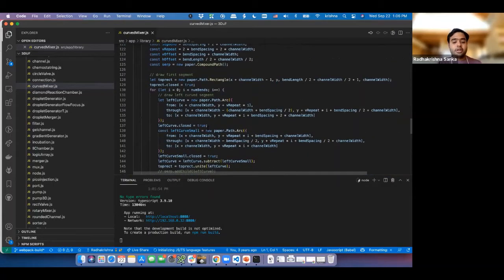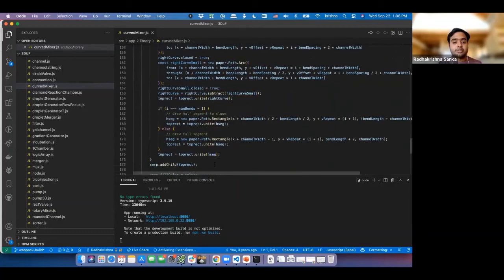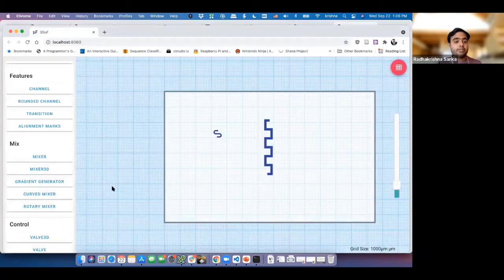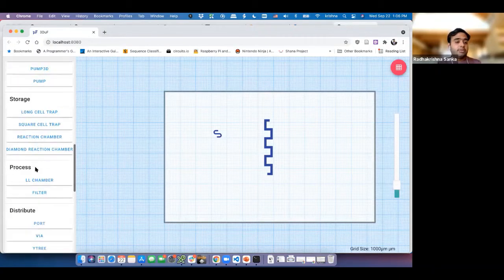So you might be wondering, okay, maybe this is complicated. I need to know how to do all these different things. How do I make something happen? Whenever you're approaching anything in a UI-based design and development environment, it's very simple. You need to break down the problem. For example, if you wanted to add a new component, the first thing you want is a new button over here. Maybe we want it in storage, we'll call it triangle trap, and you want a new button showing up over here.